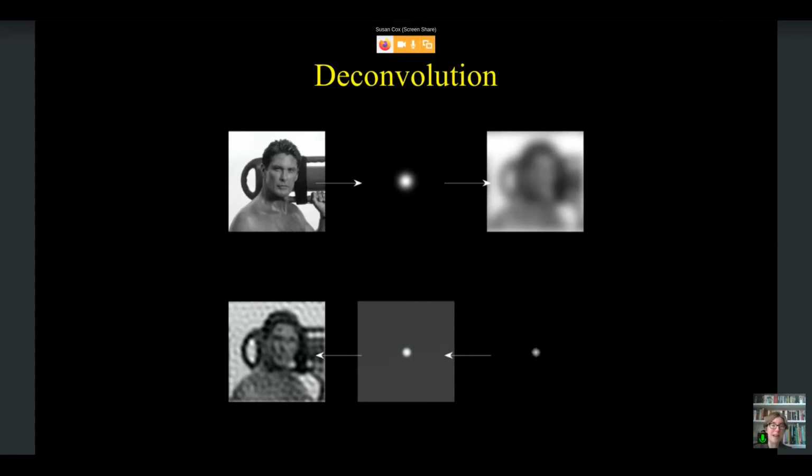So if we compare the bottom left to the top right image, you can see the bottom left image is much sharper. It's got a better signal to noise, and particularly features like the gaps in the board that he's holding are much more distinct. However, you'll also notice that there's a distinct stippling effect.